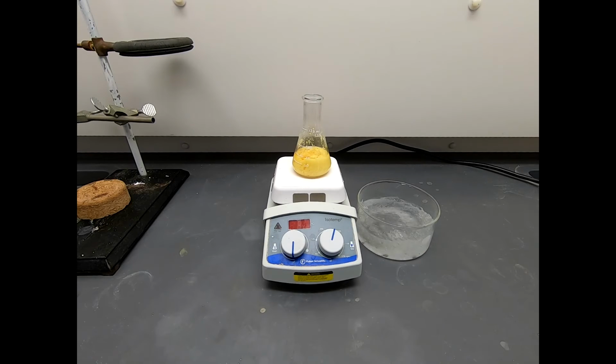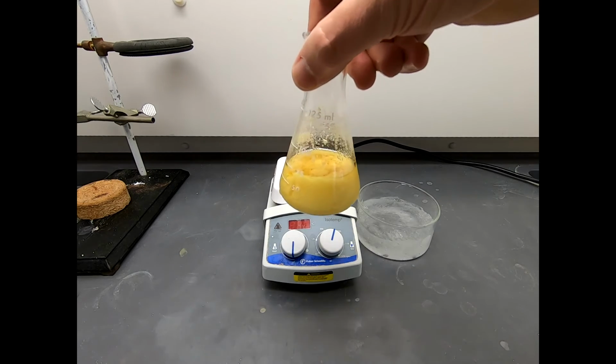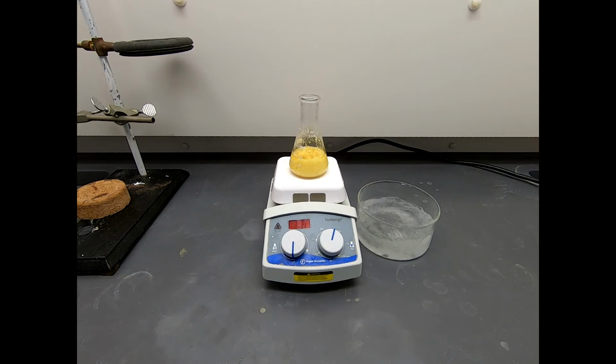It's about an hour later, and here we are. This thing is super thick with solid. Bring it into view. You can see it's more solid than liquid, it seems, which is not really true, but it regardless has a lot of solid in it.